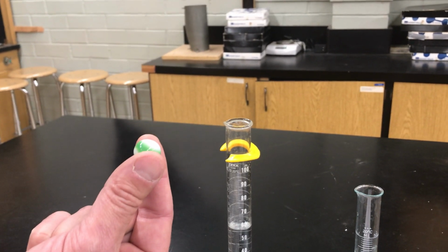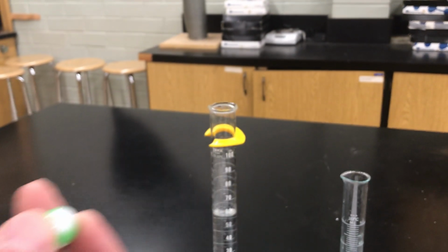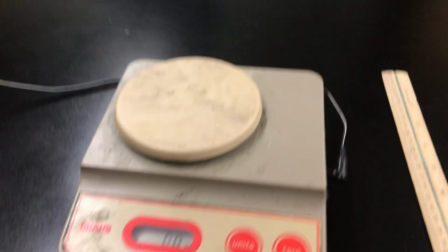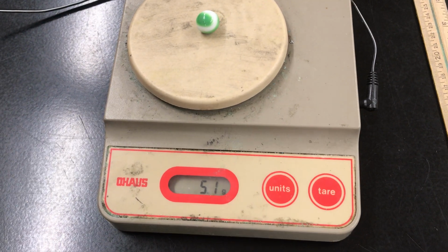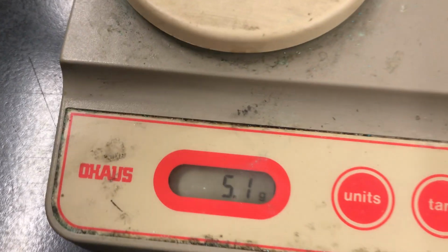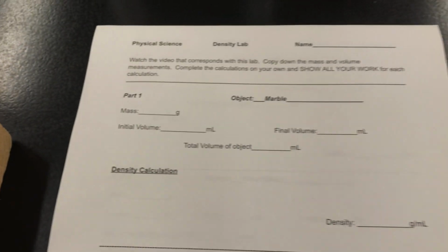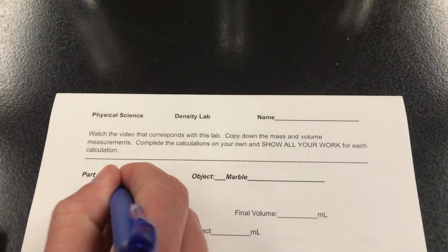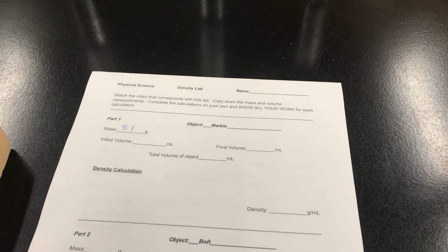And there's 2 things we need for density. We need mass and volume, okay? So first, let's go ahead and get the mass. Over here we've got a scale. Okay, if I put this on the scale and I try to keep it from rolling off, this says that marble weighs 5.1 grams. So I want you to write that down. I'm going to show you where. We're going to write down 5.1 grams as the mass. Okay, now I'm not going to do this for every one of these. You're going to write these down as we go, but I'm going to model for you where the information would be best put.